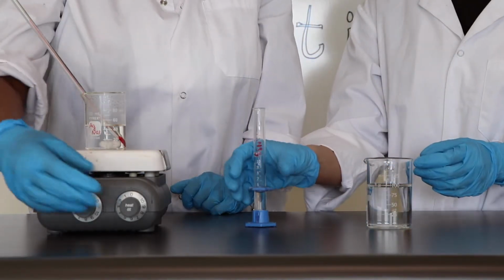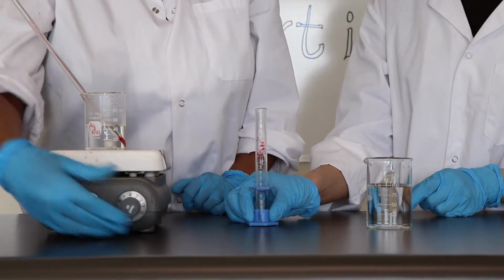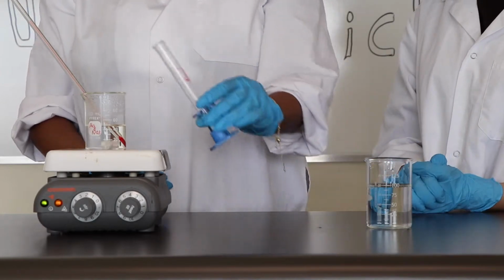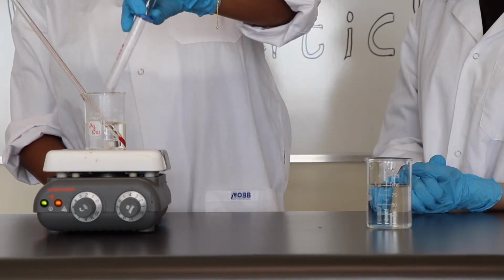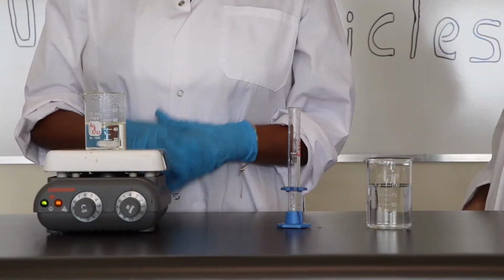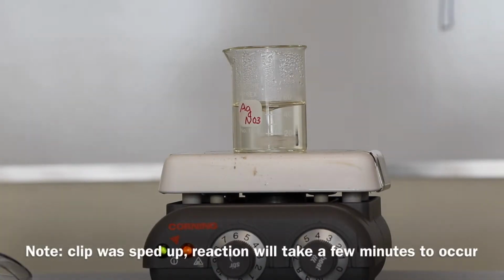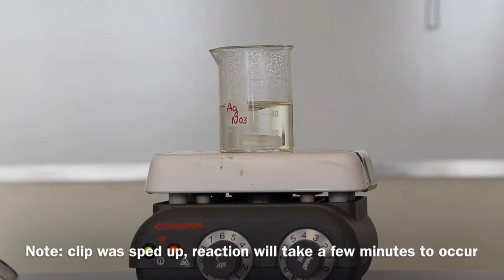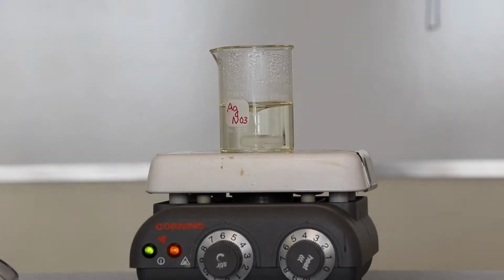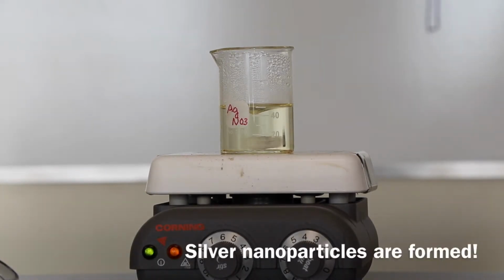Use 5 milliliters of trisodium citrate solution and pour it into the silver nitrate solution. A successful procedure will result in a yellow solution.